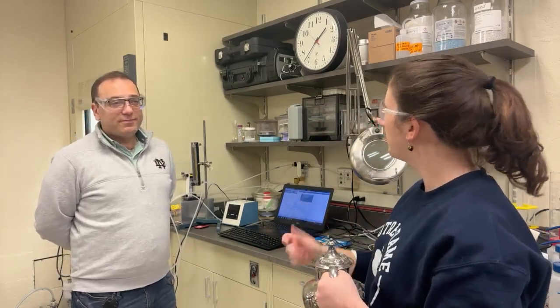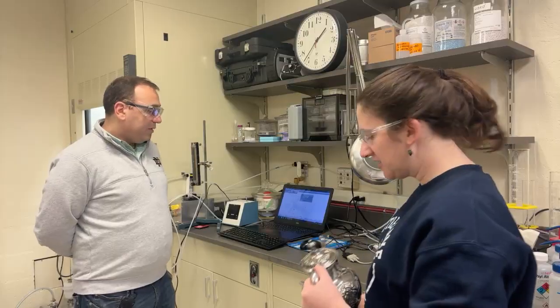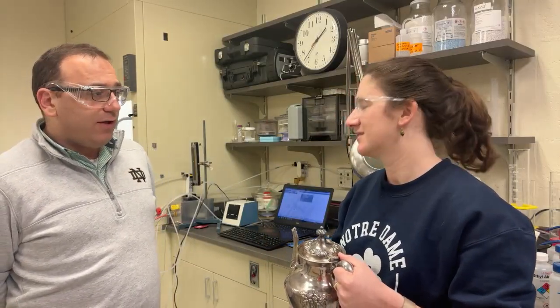Yeah. And we had about the same exposure time on both of them, about 10 seconds or so. All right. Well, we have a smaller piece than this, so we can do it more conveniently. We can put it in a benchtop device, run a little bit longer and then try to compare them. If it's two or three metals, we can maybe get away without calibration.